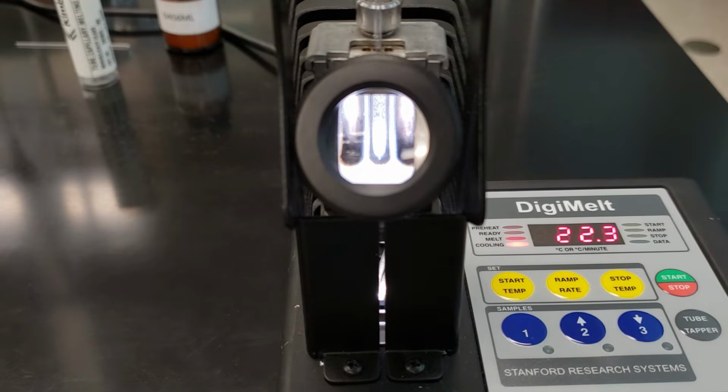We finished our fast melting point determination for our first sample. It was 122.7 to 124.8 degrees Celsius. That gives us a good range for our unknown's melting point. We're going to go back and do a slower ramp speed of about 5 degrees per minute to give us a little bit more of a specific or dialed in melting point.